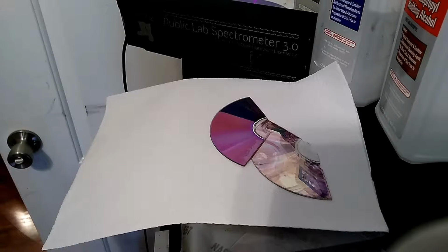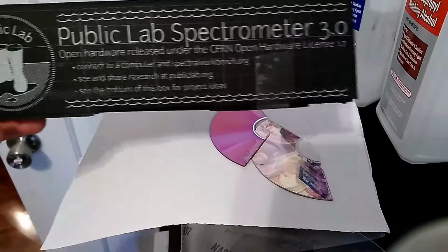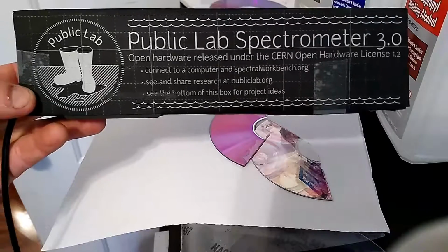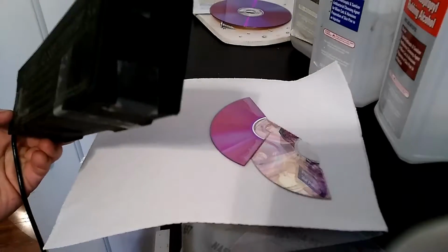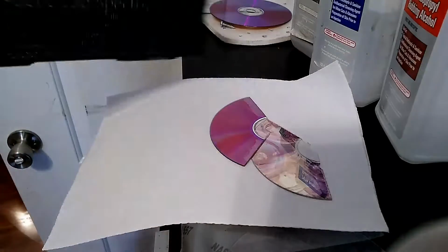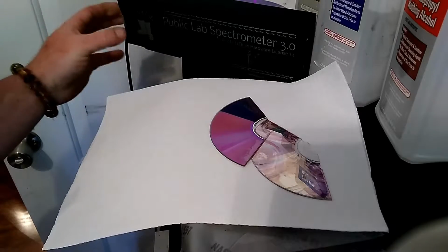tells how well the plants can use the energy from whatever distance, instead of lux and lumens and all of that, which doesn't really have anything to do with plants as it does with humans. So to calibrate and make sure, I got the Public Lab Spectrometer 3.0. It was very easy to put together, and I have some really bad hand issues for really tiny work.